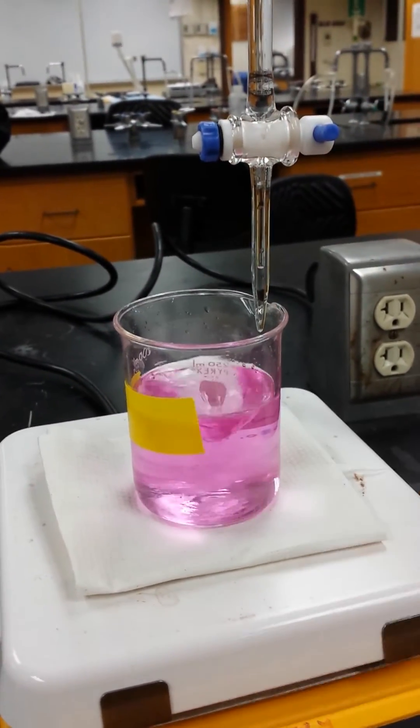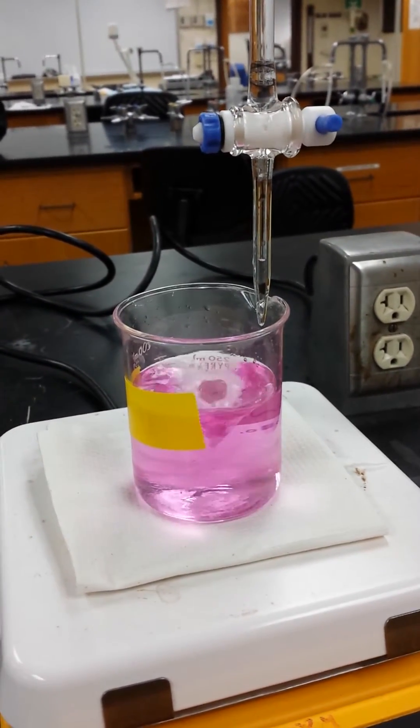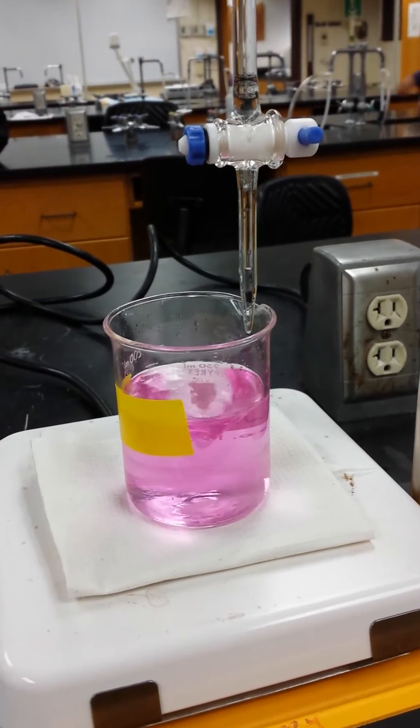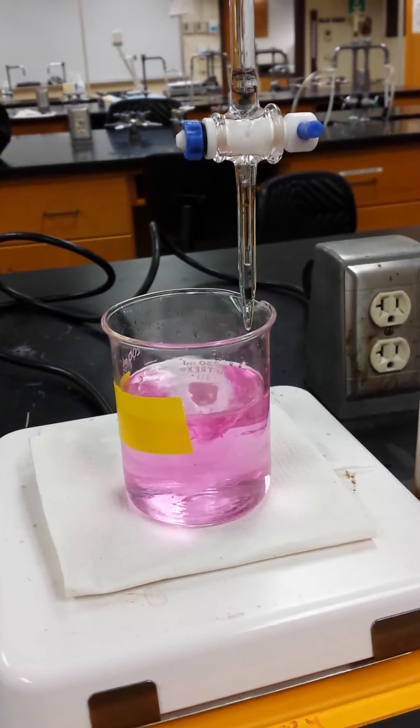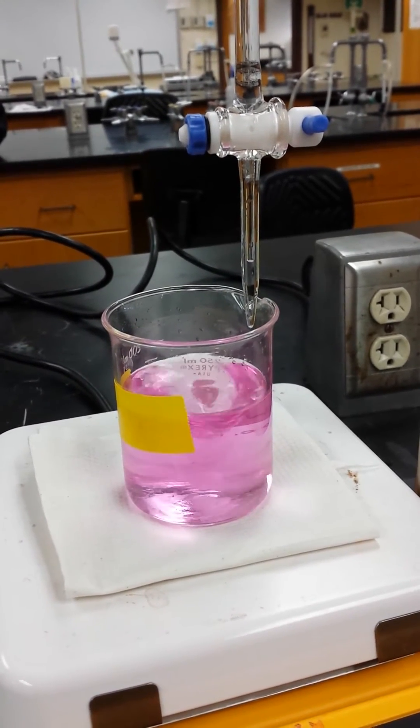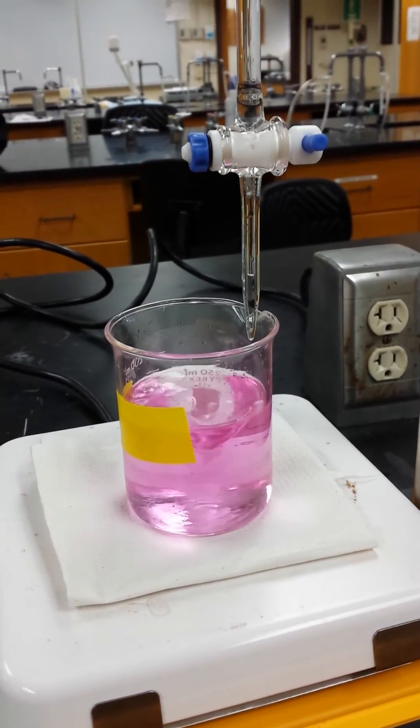30 seconds. Oh, the 32. Well, I know some procedures, like this last one, but I guess this has been done so often that he says all you have to do is keep it to less than 60 degrees. Then you just see it on the clock.